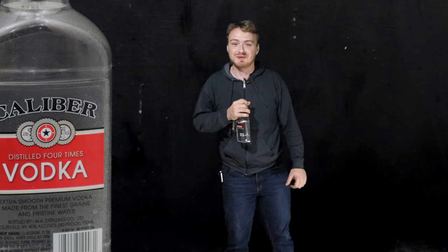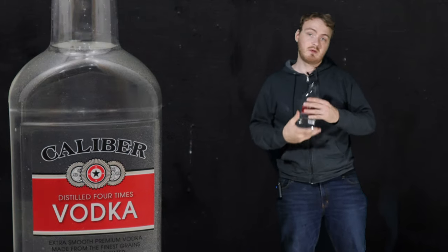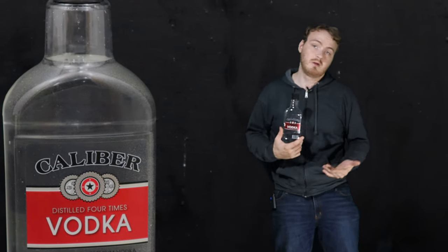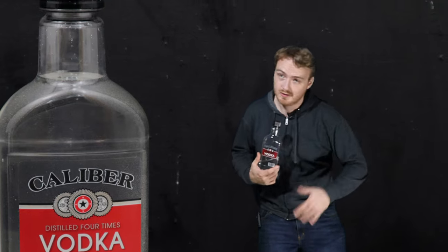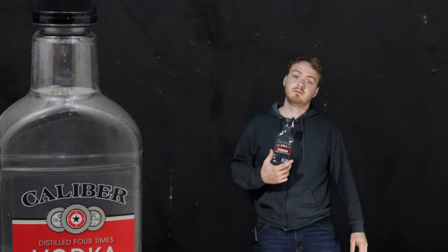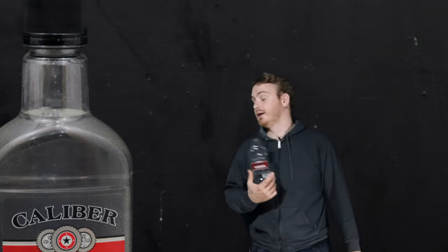Hello and welcome to Chemical Distraction. So today we're going to be turning this 40% vodka into 100% alcohol. 99.99.